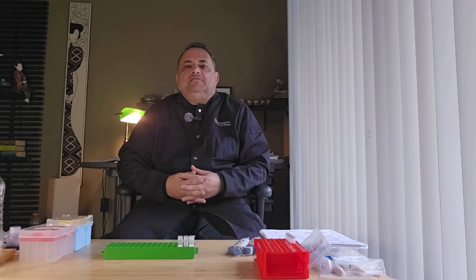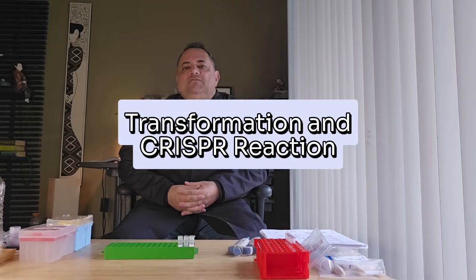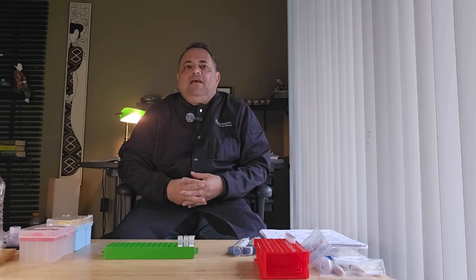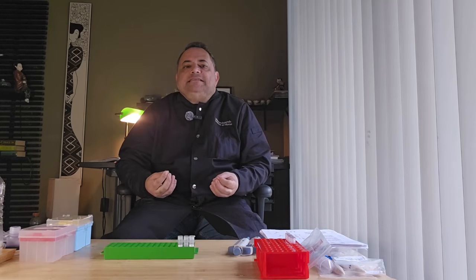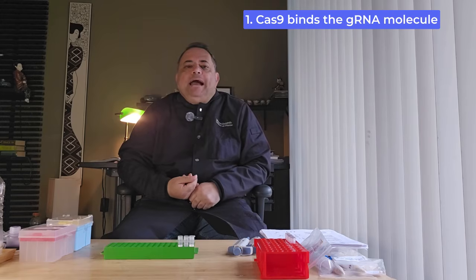Okay, we are going to now move on to the next stage, which is DNA transformation and the CRISPR reaction. DNA transformation is the process by which bacteria take up foreign DNA from their surroundings and incorporate it into their cells. The steps of the CRISPR reaction include: first, the Cas9 binding to the guide RNA molecule.